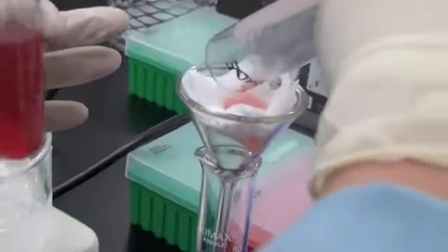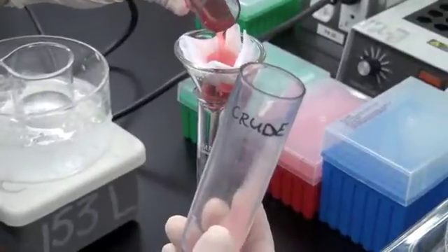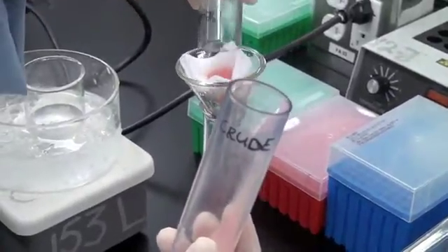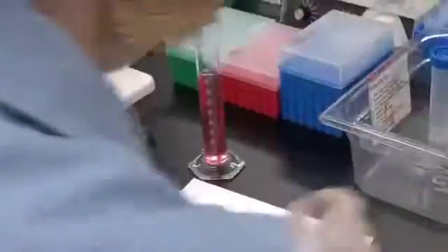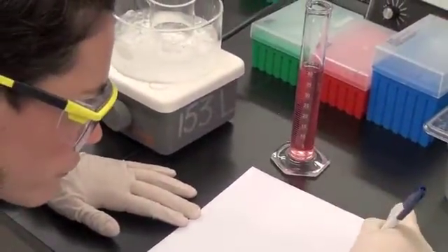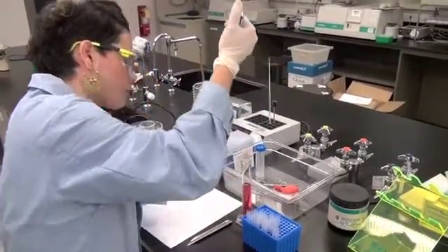While she decants the supernatant through the filter, she keeps the pellet at the top side of the tube so the supernatant does not accidentally wash out the pellet during the pouring. Biochemist Dicer is also carefully measuring her total volume for her purification table calculations. The volume should include the testing aliquot volume, even though that volume is lost because it is saved for assays.